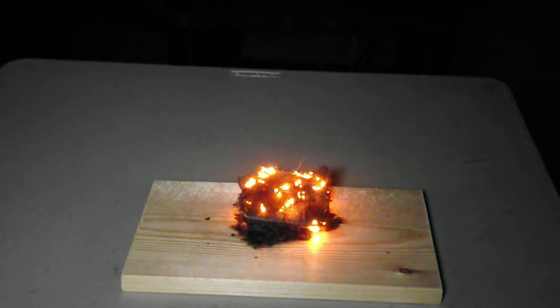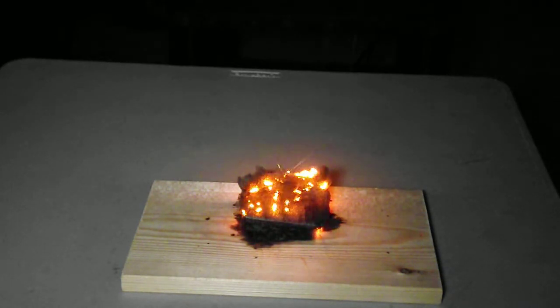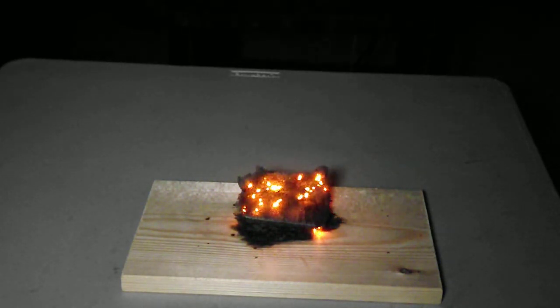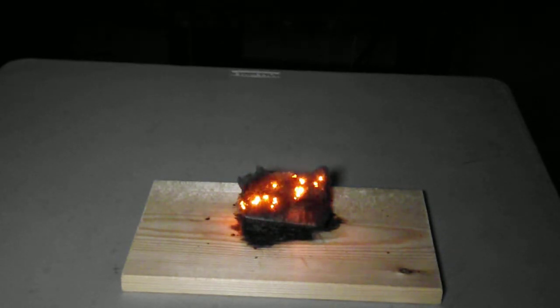If I increase the amount of oxygen — right now there's about 0.21 bar because we're just using air — if I increase the amount of oxygen, I will hopefully increase the reaction rate.